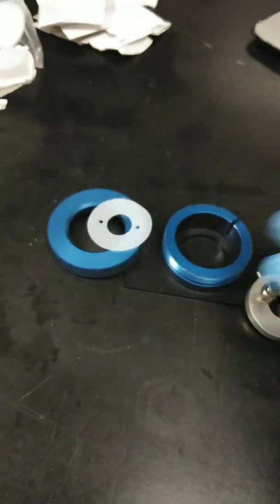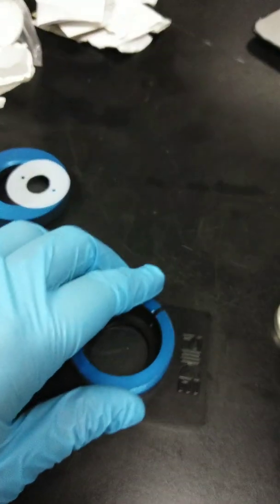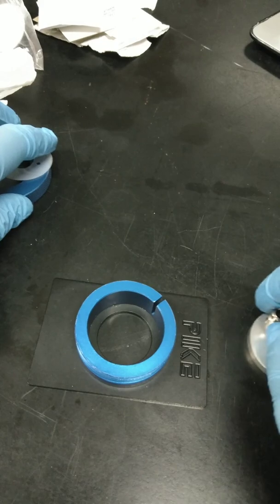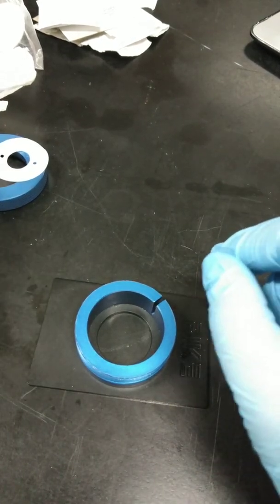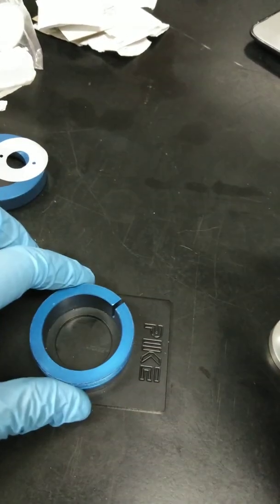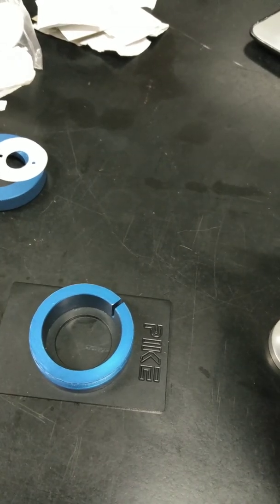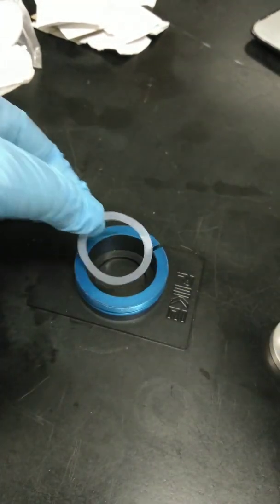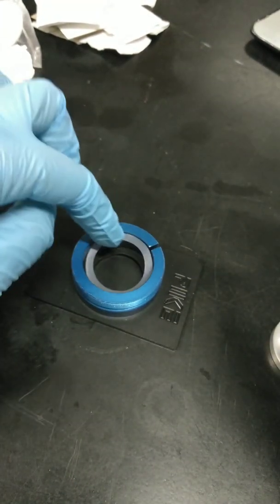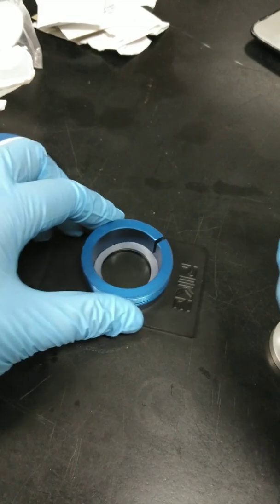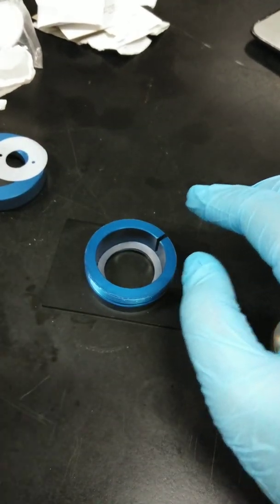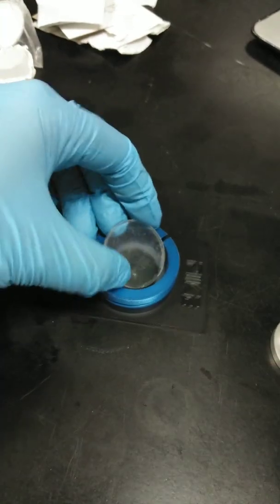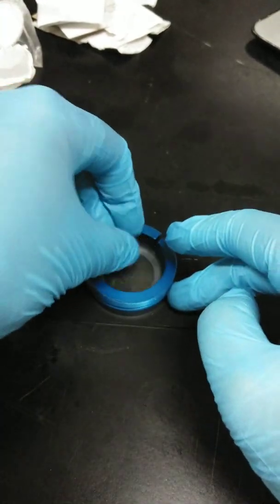So the first thing to do is to place your slide mount cell holder flat on top of the table. And then, we have to position one gasket at the bottom of the well. So, let's just use this gasket, a very thin one. Over here. And then, we need to place the first IR window which is the plain one, not the drilled one, on top of that.